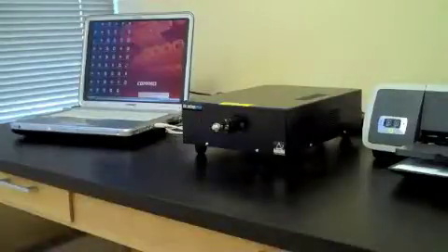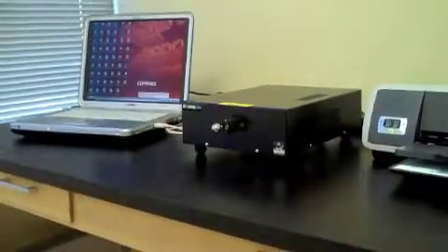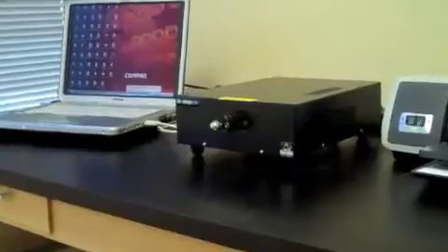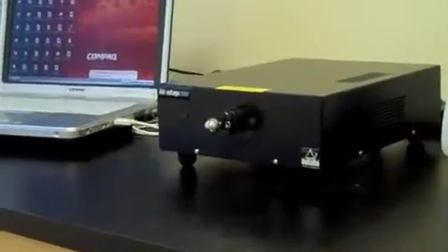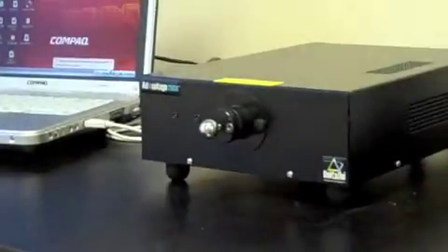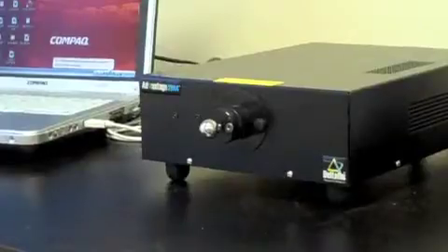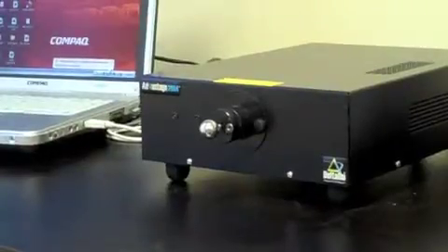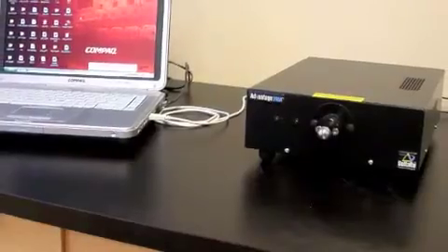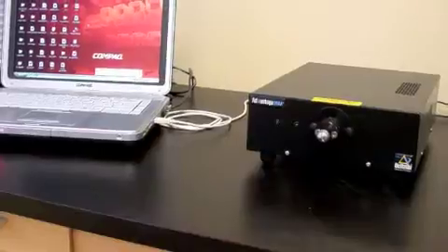In this video, we will demonstrate the standard operating procedure for the chemistry department's Advantage 200A Laser Raman Spectrometer, built by Delta Nu. It sits on the bench near the window in room 467 and is controlled by the software on the laptop computer on the same bench.